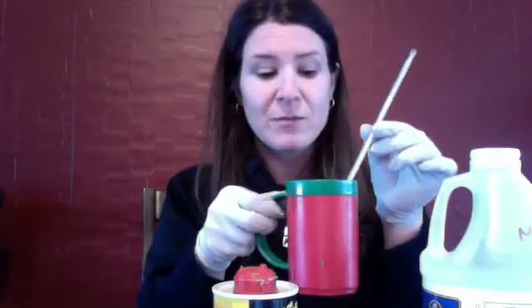Okay chemistry, this is experiment 13.1 on enthalpy and it's also a review of calorimetry. When we used the calorimeters we used two styrofoam cups. I don't have a styrofoam cup so this is actually a little plastic mug. It also is insulated with air so it's gonna be pretty decent.